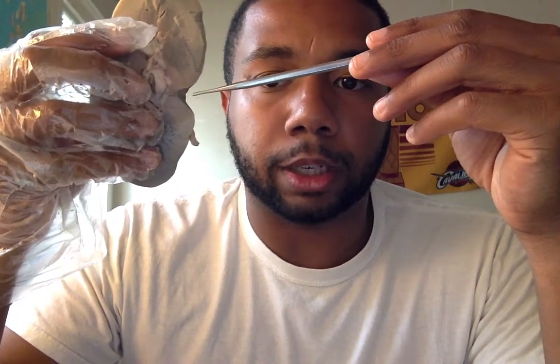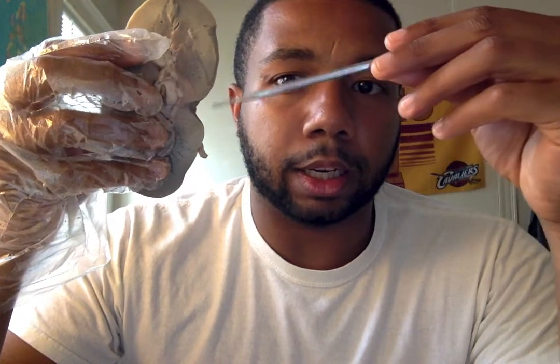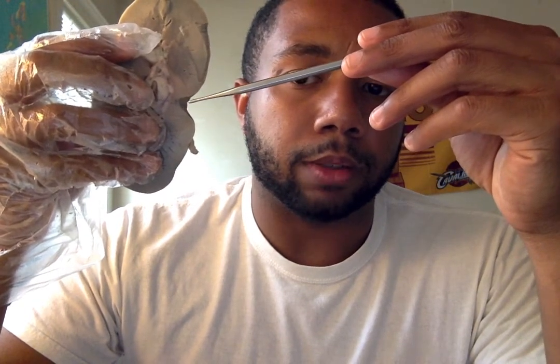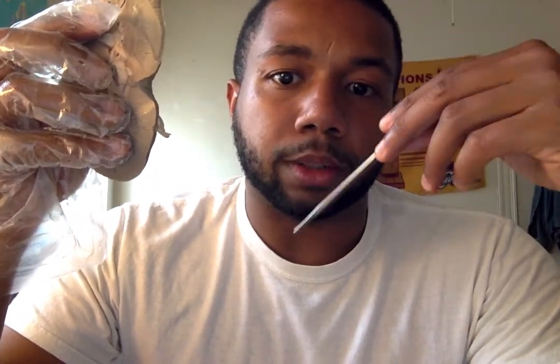Within the renal hilum, it contains the renal artery, which has blood going directly into the kidney, and then that spreads around all the nephrons, and then the blood will exit through the renal vein, which is also at the renal hilum. And here, this is the site where the renal pelvis will drain into the superior portion of the ureter, which I think should be this right here. And the superior portion of the ureter sends the waste down to the bladder, and then eventually the bladder goes to the urethra, where it can be expelled as urinary waste.